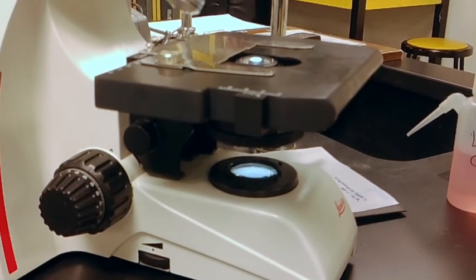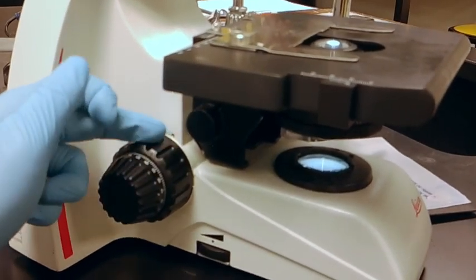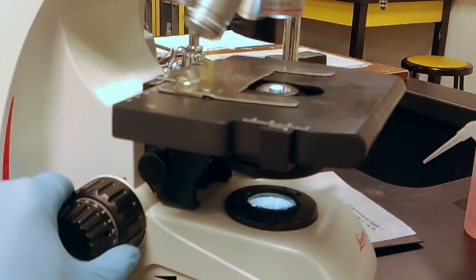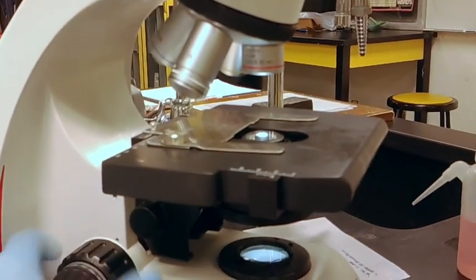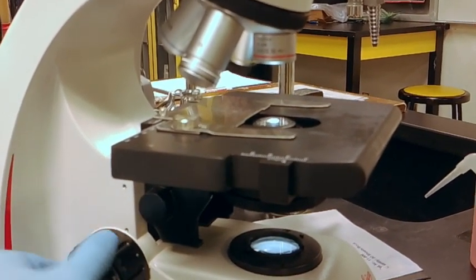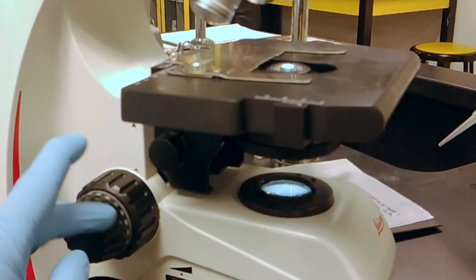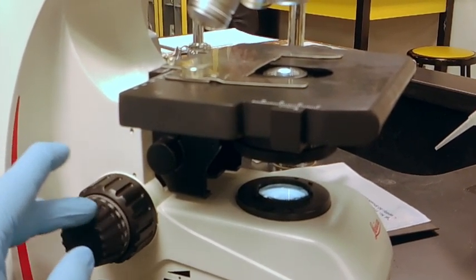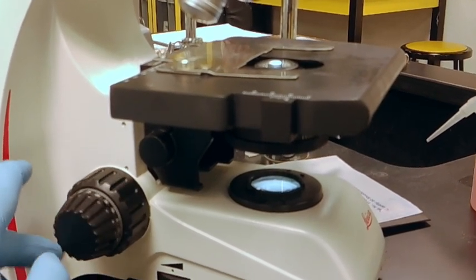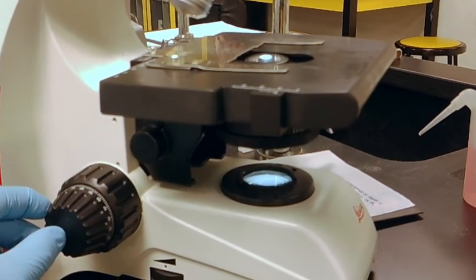To adjust the height of your stage, you have two adjustments. You have the innermost ring, your large knob, which is a coarse adjustment. So it'll move the stage up or down, depending on which way you turn. And then the fine adjustment, which is on the outside, does the same job as the coarse adjustment. As you can see, the coarse adjustment is still turning, depending on which way I turn the fine adjustment. However, this again is for fine adjustment in the microscope for focusing.